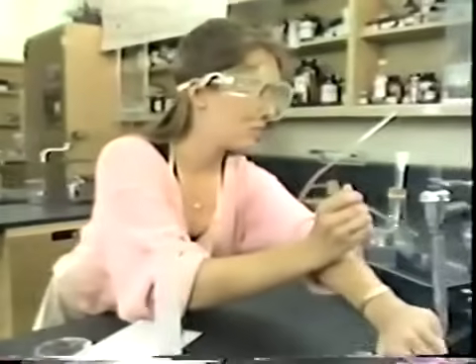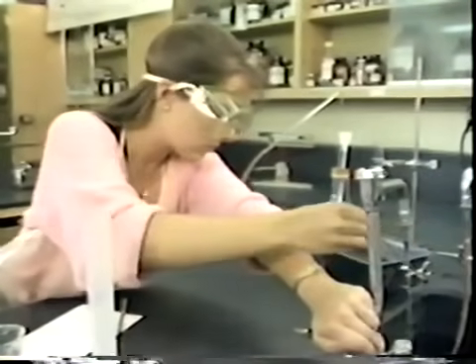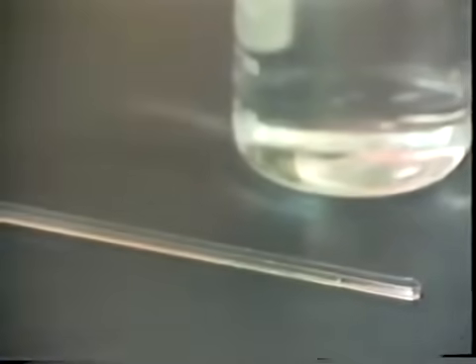Then I rinsed the stirring rod in water and placed it on the bench. You're not going to believe this, but once I saw a guy put a stirring rod in his mouth. A good rule in the lab is to put nothing in your mouth. You should never touch the chemicals with your hands either.